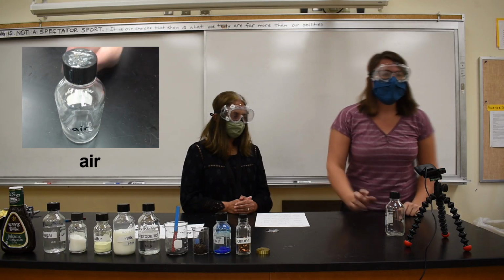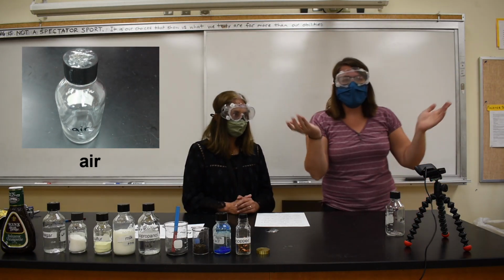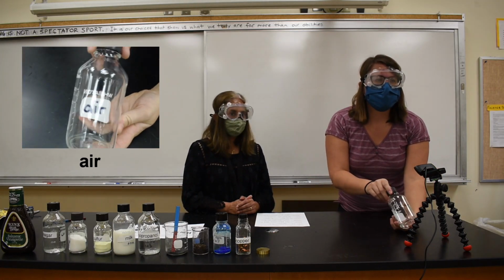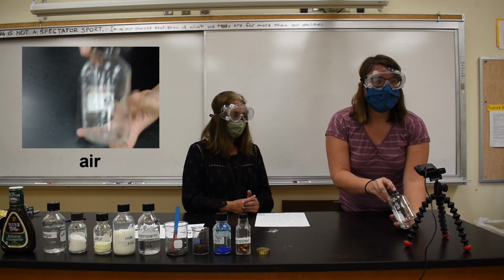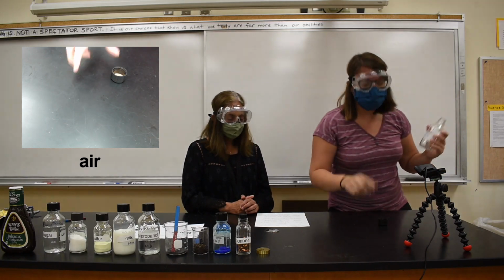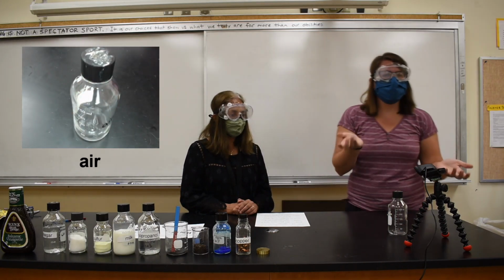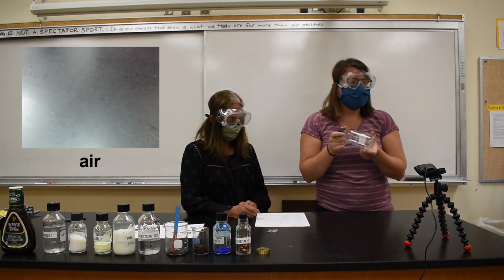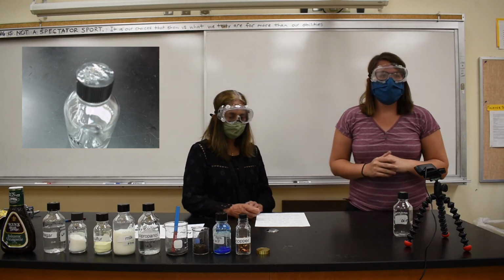Our first substance is air. Just normal, plain air. So we have a sample of air here. You can see it's clear. Miss Sullivan's going to open it. It has no smell, as you can see. She's safely taking her mask off. Just smells like air. And it fills whatever container that it's in. It fills the container, the air that's in the room. It fills the room. So that's our first substance, air.